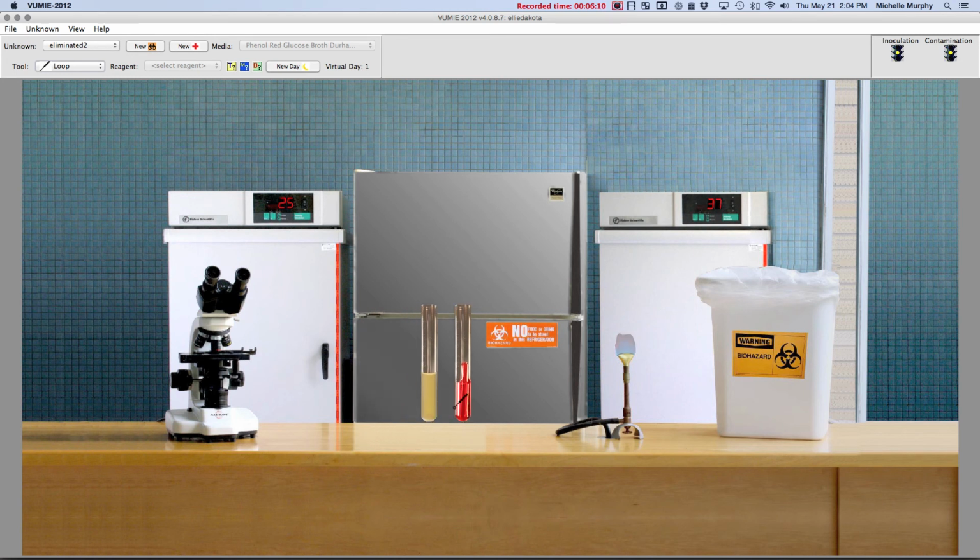You're going to pick up your tubes with your mouse. You're going to flame the media, flame the inoculum. Then you're going to go into the inoculum. This is the bacteria. You're going to pick up some. You're going to take it over to the clean media here. You're going to put some in there, and you'll see as I come out, it's going to say media stabbed. That means it was inoculated, and you can see the green stoplight up here means you were successful. If that's not green, you did something wrong.